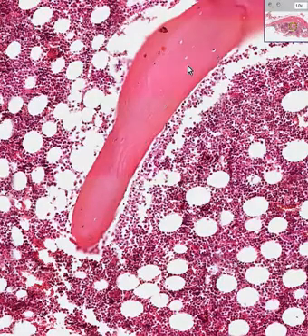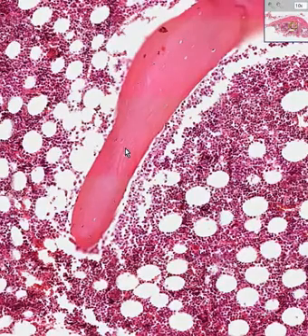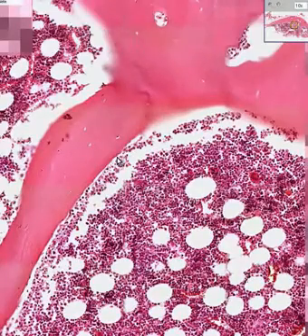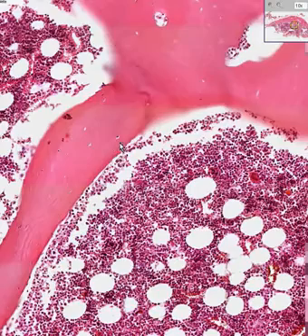You see a more concentric or lamellar deposition of bone. But the principle is the same. You have these rims of osteoblasts on the outside of the spicule, and as it grows, these osteoblasts get trapped up within the middle of the spicule to become osteocytes.